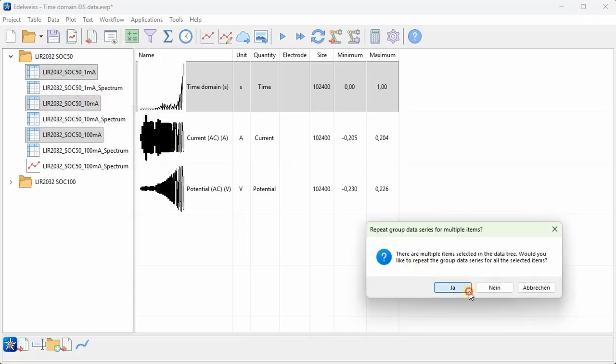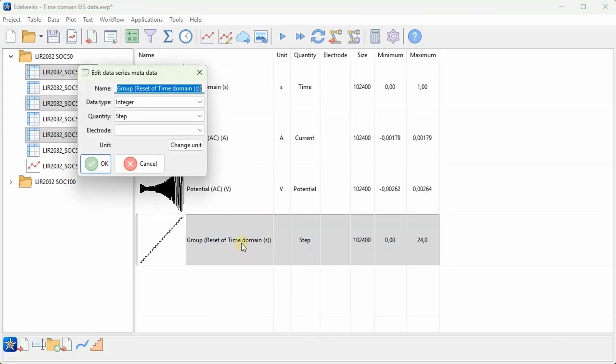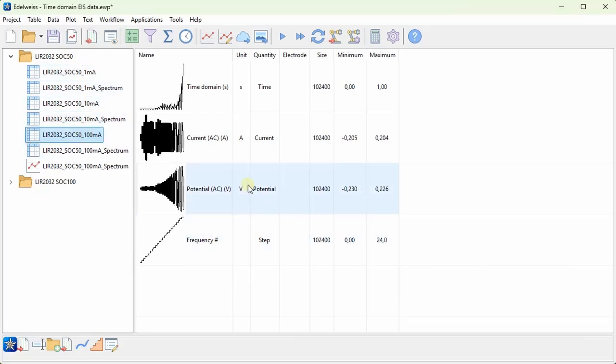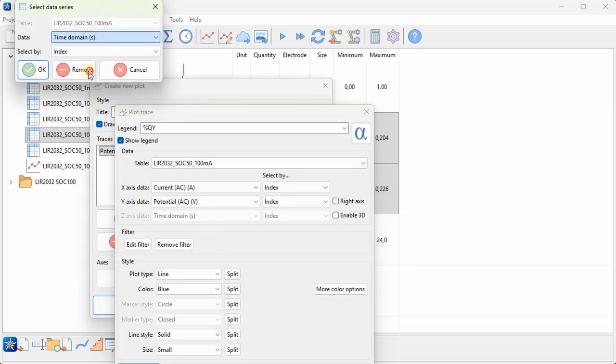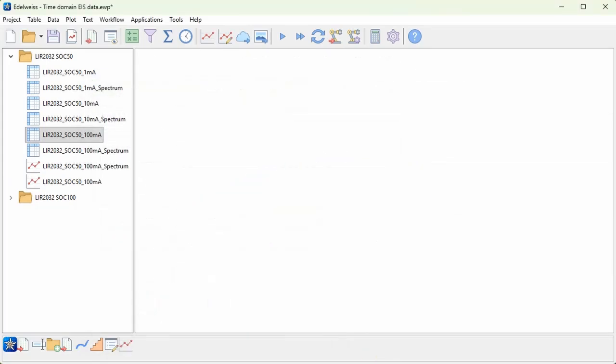I choose yes and yes to do it for each table, and maybe I will also double click on this to rename it to something like frequency number, and choose yes to do it for all three tables again. So now I have this information about the frequency in each of these three tables. And if I plot the current versus potential and I split it based on this frequency number, I will also label it based on that.